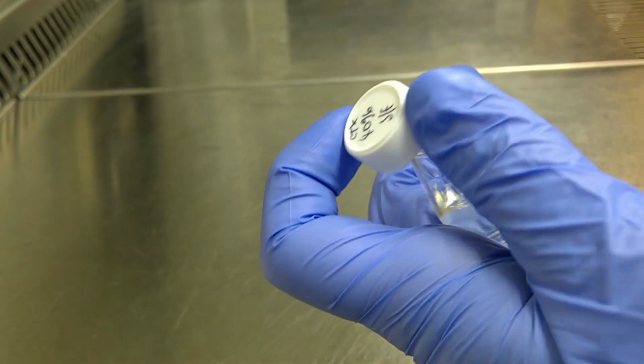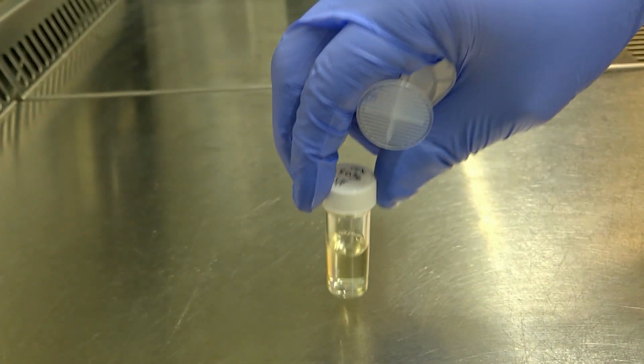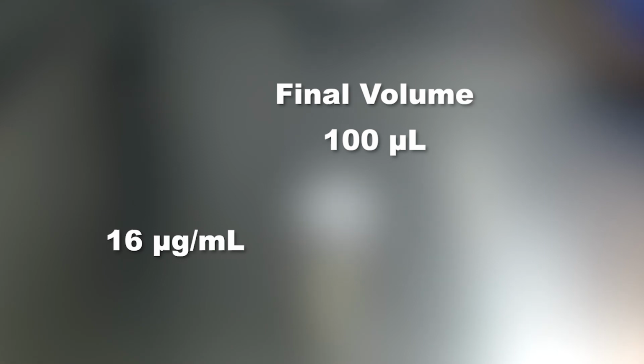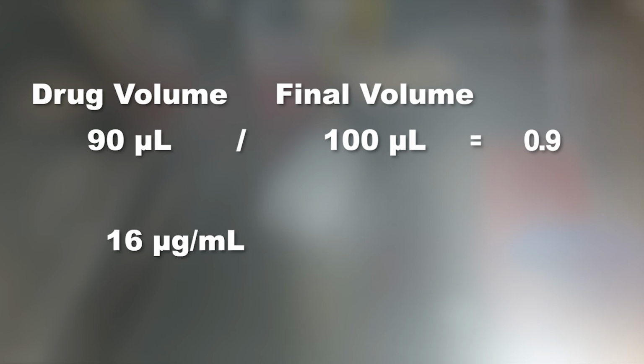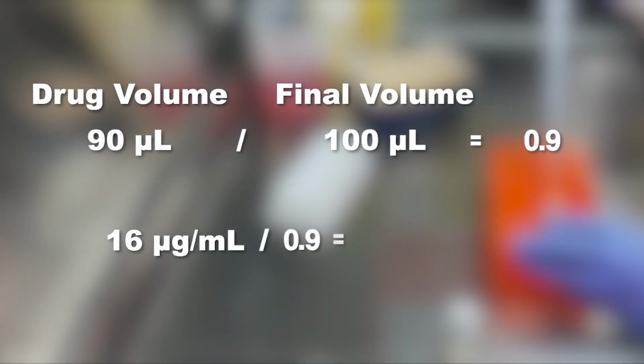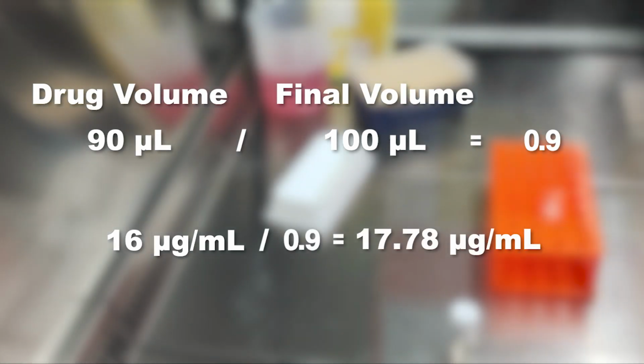Now we need to dilute our stock solution to the maximum concentration that we are going to use in our assay. In this case, it will be 16 micrograms per ml that we need. The final volume of each well in our 96 well plate assay will be 100 microlitres. 90 microlitres of this will be our drug solution with 10 microlitres of cell suspension added and diluting it as a consequence. Because of that, our drug concentration will need to be adjusted. To achieve a final concentration of 16 micrograms per ml in our maximum concentration wells, we will need a solution of 17.78 micrograms per ml.